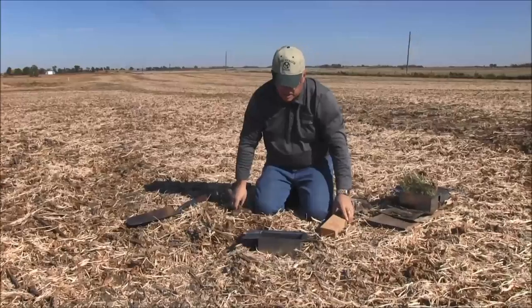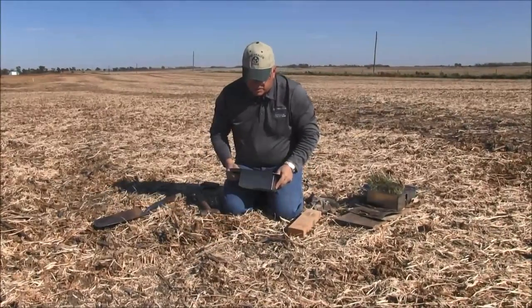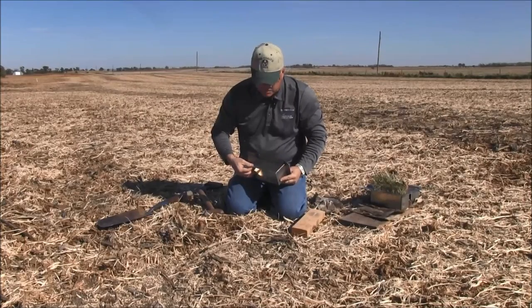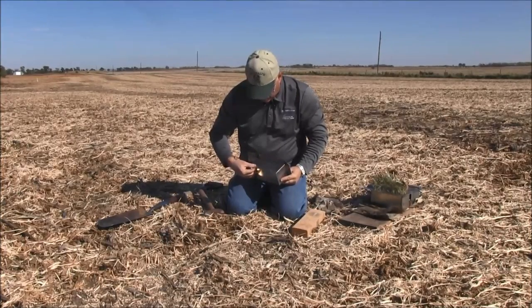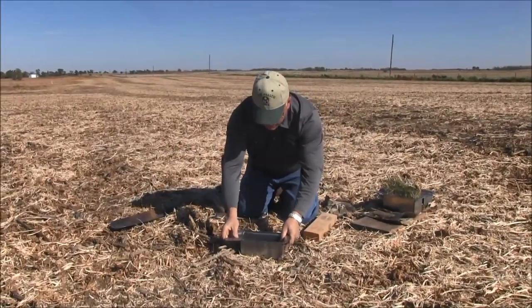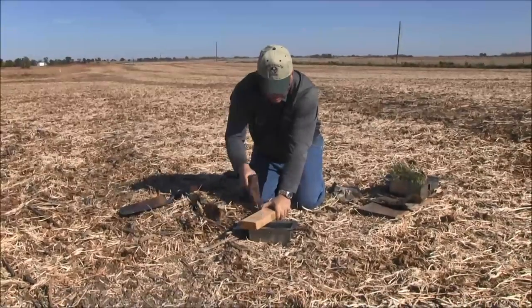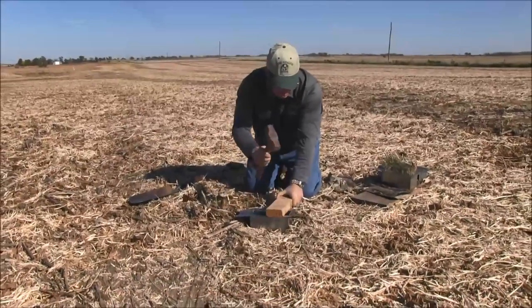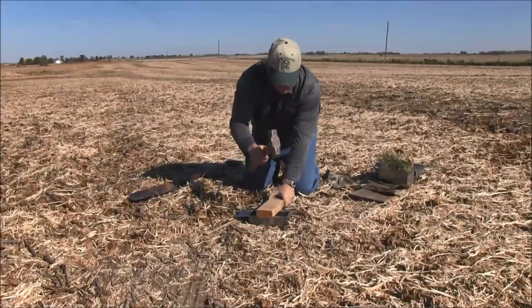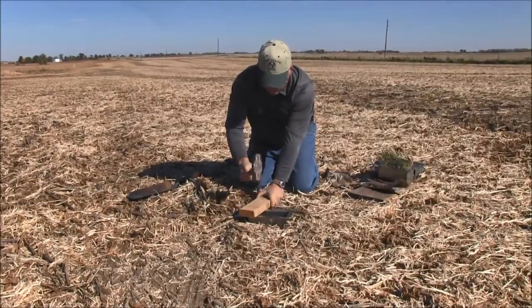We place our cutter and remove some of the residue because of hairpinning potential. A lot of times residue, especially if it's moist, will move along the edge of that cutter and will not cut off completely. But if we remove some of that residue on the soil surface and set our cutter, try to drive it in very uniformly, putting pressure on the corners.